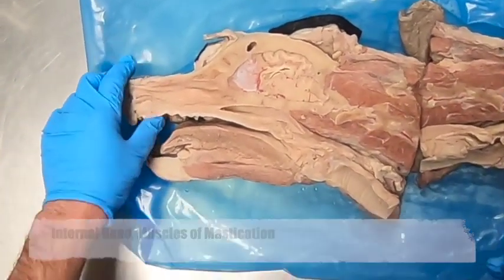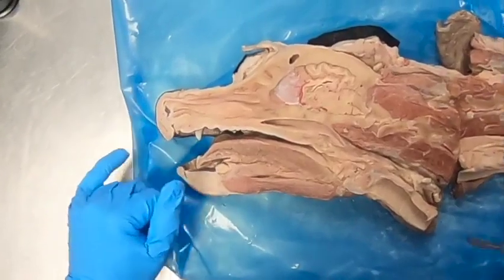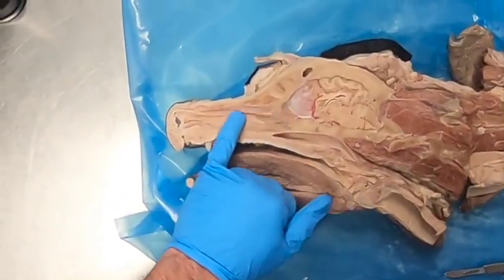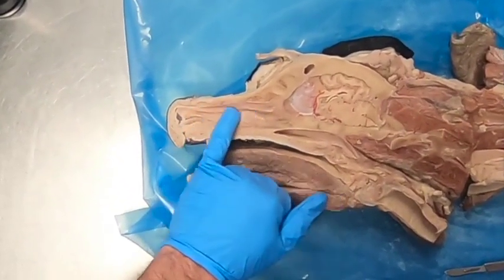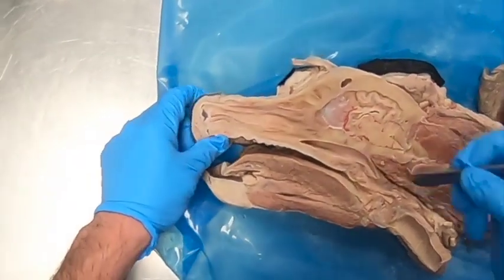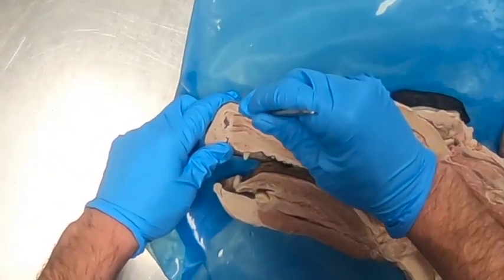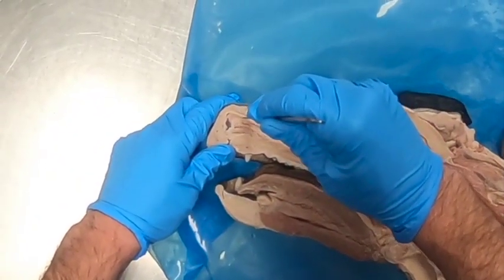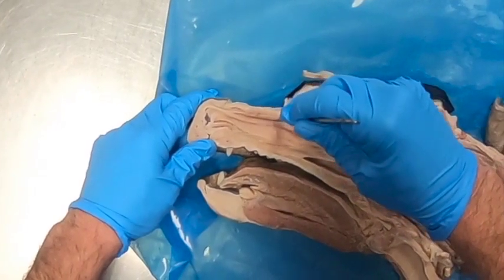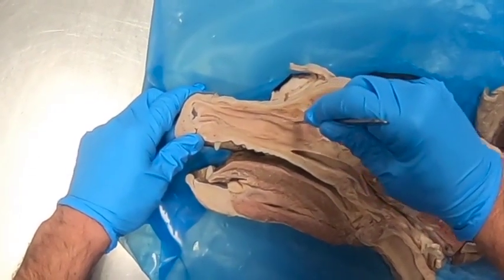Let us now look through some of the structures of the head. We see here on this side that the nasal septum is still intact. We're going to go ahead and remove that, the nasal septum being cartilaginous.